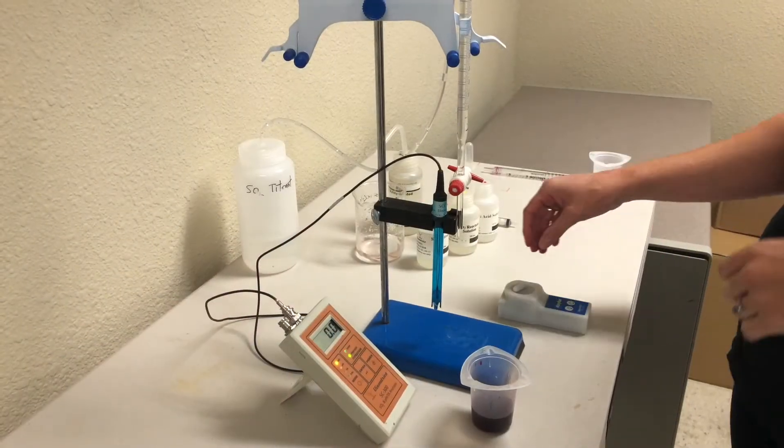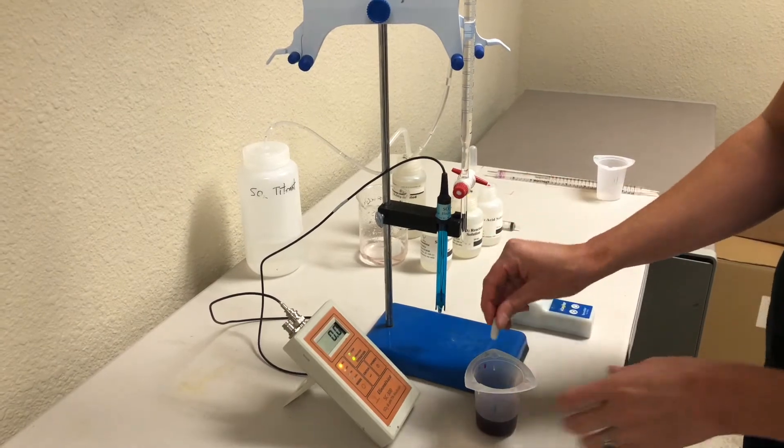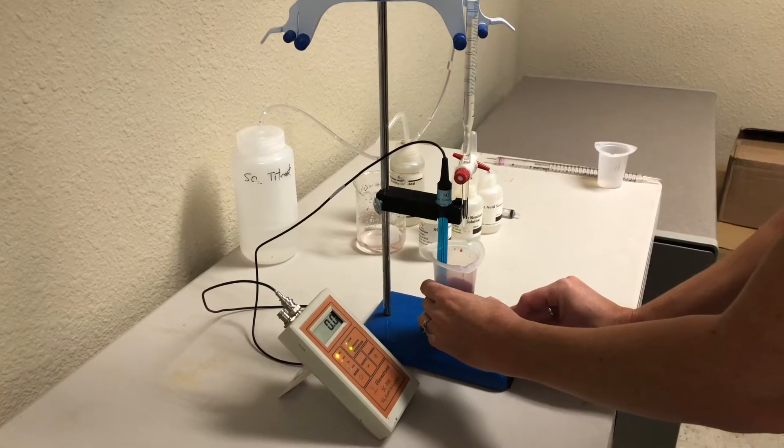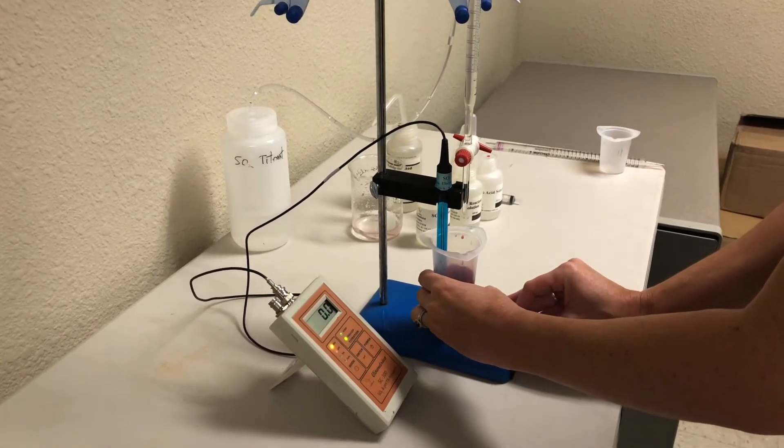I'm now ready to run the test, so I'll put my magnetic stir bar in the wine sample, get this set up, and make sure the solution is stirring.